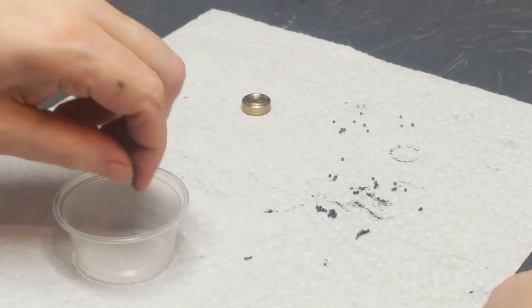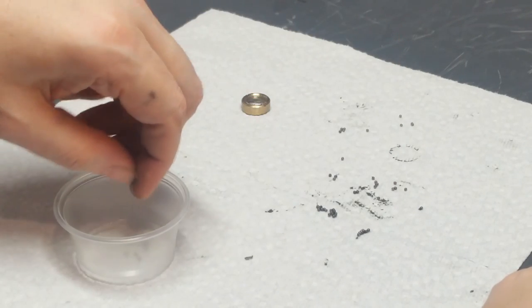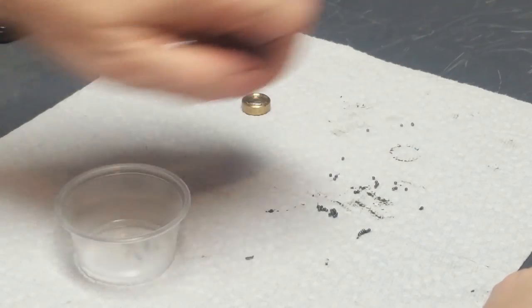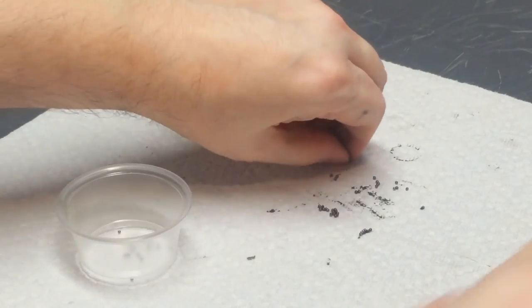I'm certainly not going to count them until it comes time to reassemble. And then if I'm missing any, I'll just grab a few out of stock and put them in. But I think it's pretty important that you put them all in there. If there's one or two missing on each side, it wouldn't be the end of the world, but you really do want 30 of them on each side.